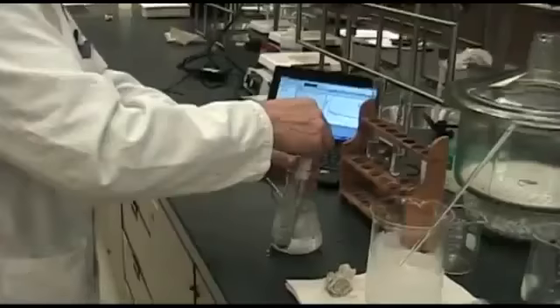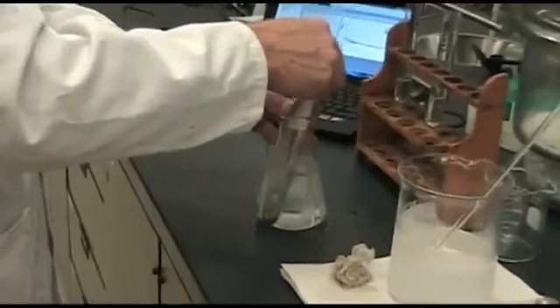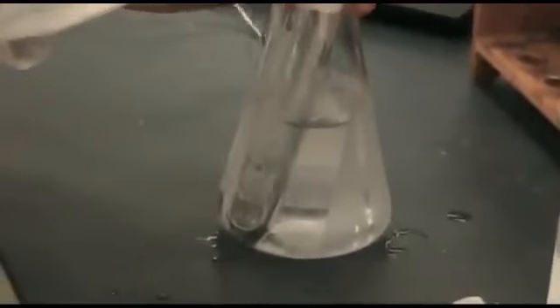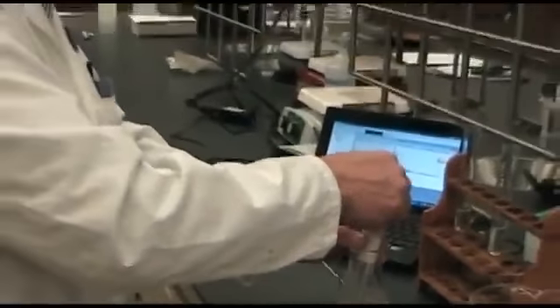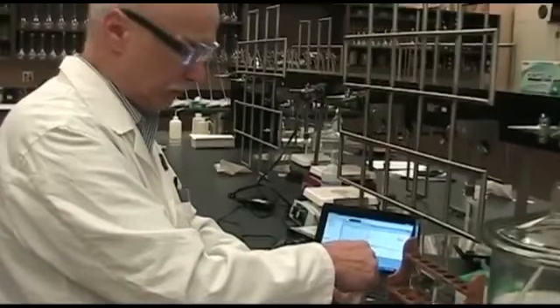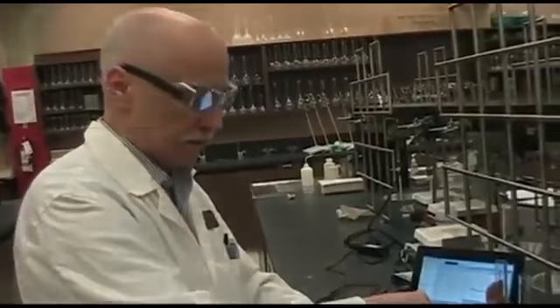as we did before. So we're getting below 0 here, and we're going to start stirring it, and as soon as I start stirring, it's gone quite back up. But knowing that it's been below 0, we know we'll be back there in a few minutes. So again, we'll let it run for the 10 minutes as we did the other two. And this is sucrose, by the way, if I didn't mention it before. And we'll see what the difference is in the reduction of the freezing points because of the different substances.